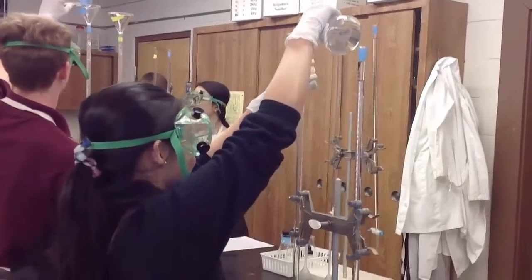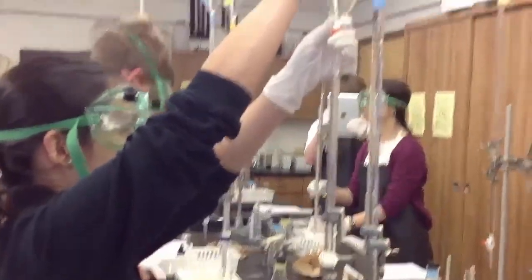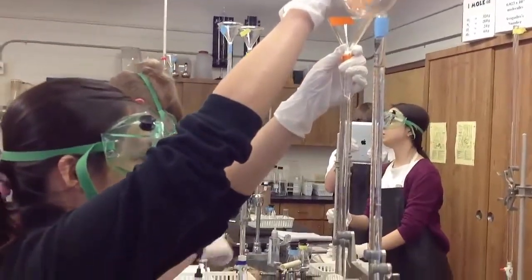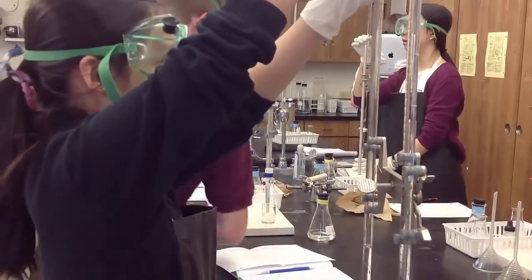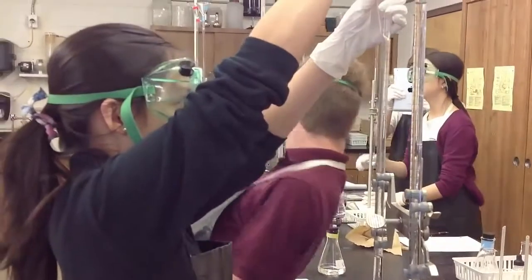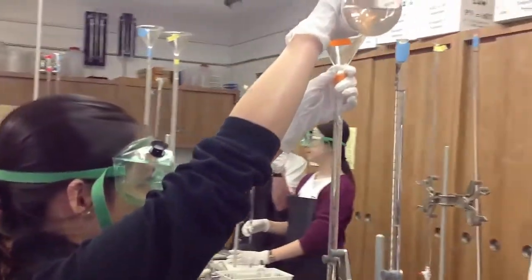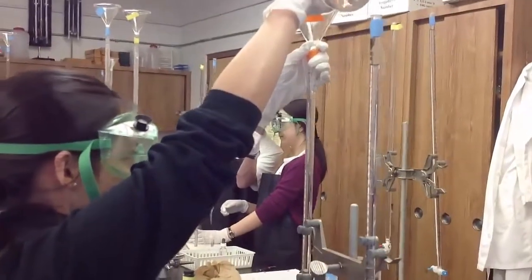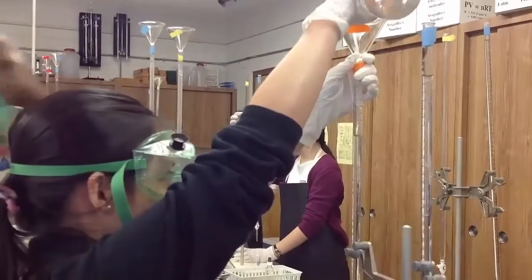First, 2 clean burettes were set up. One burette was used for the acid and the other was used for the base. The acid burette was rinsed 3 times with the acid and the base burette was rinsed 3 times with the base. The acid burette was filled to a point above the 0 milliliter calibration mark with the unknown acid concentration. Some of the acid was released from the burette to remove any air bubbles that were present.